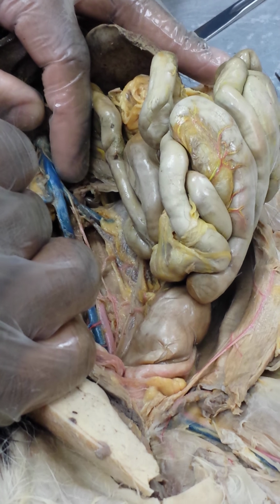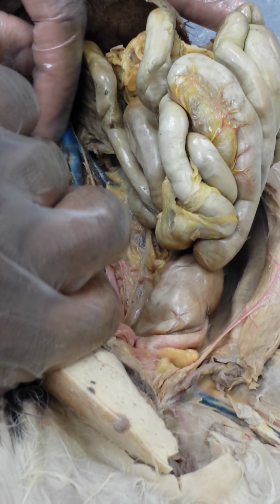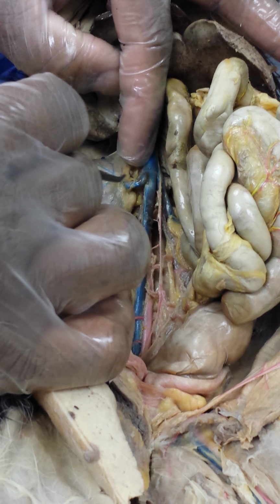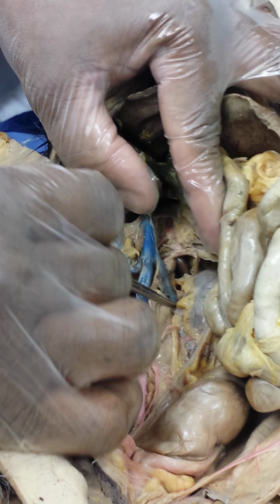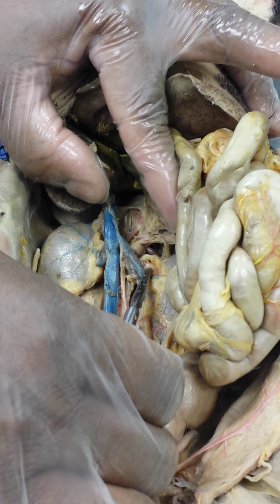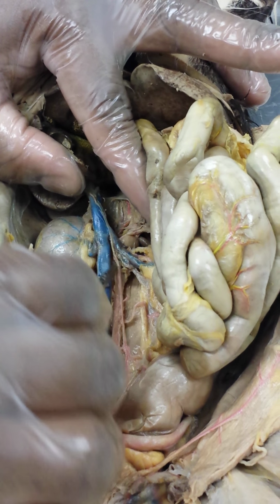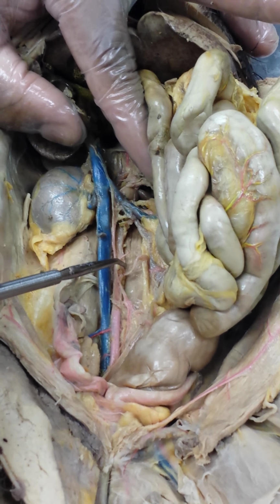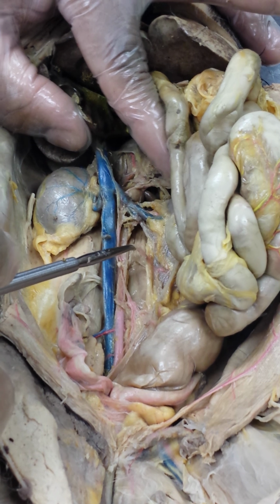The third branches are the renal arteries, which you see entering at the renal hilum, along with the vein. The vein is quite prominent. The arteries always run with it, so you can see it on this one a little better. Renal artery, renal vein. This is the third branch of the abdominal aorta, descending aorta. Then you see some of these smaller branches transected. You see that? And this.